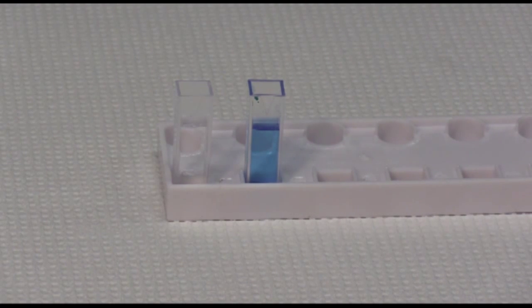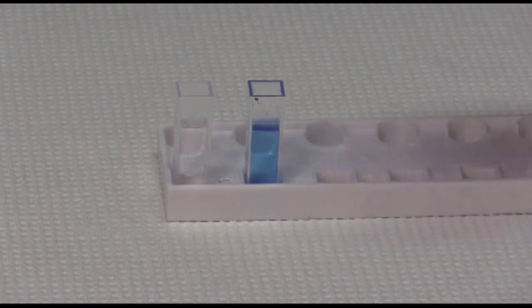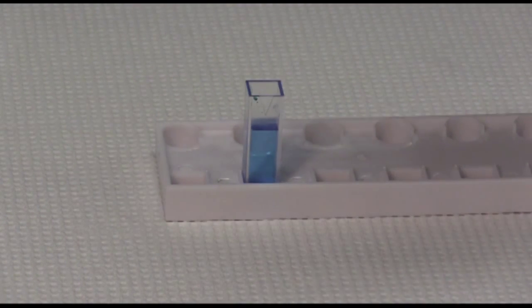In this lab, we'll be using plastic disposable cuvettes. So when you are done with them, you can throw them away. Our cuvettes will be clear on all four sides. However, the front will have an arrow on the front.